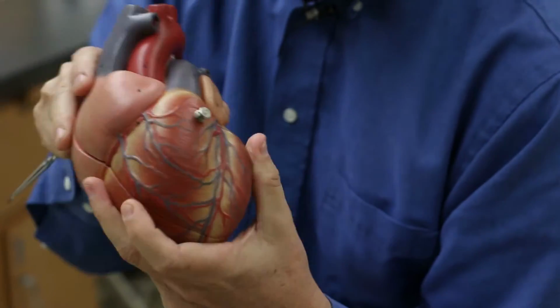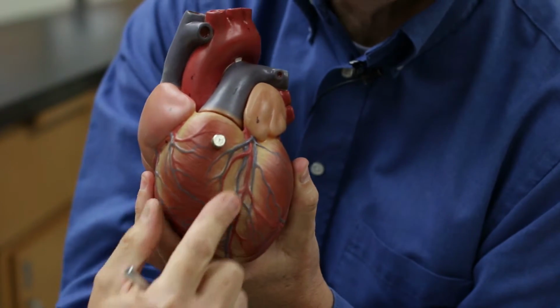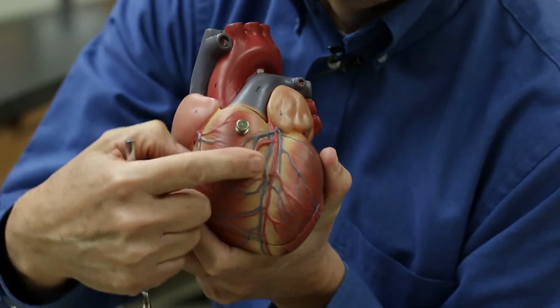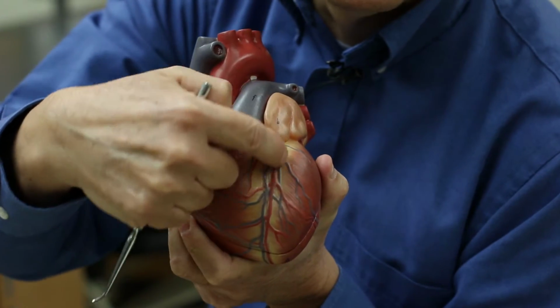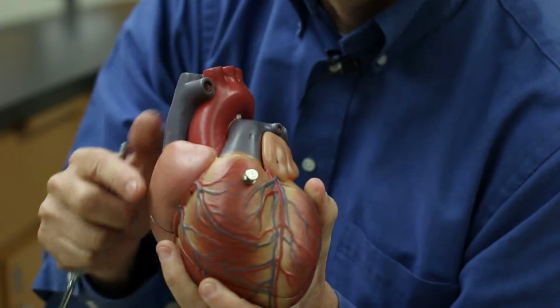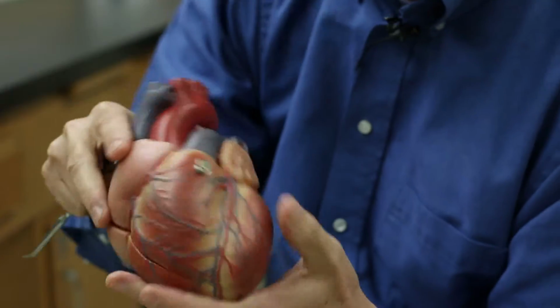Now, you'll see there's a little space, a little indentation right here between the 2 ventricles. This is the interventricular sulcus. And it's a spot where the blood vessels that supply the heart with blood run down. You can see here, those will be a little hard to see when we go into the sheep heart. You see there's another one with blood vessels running down this direction.